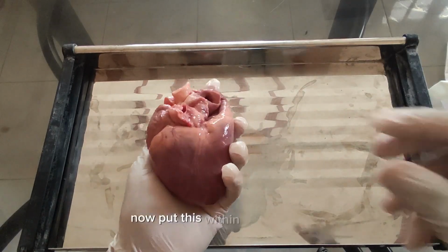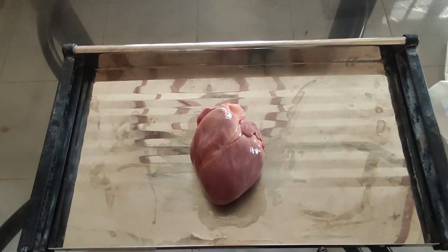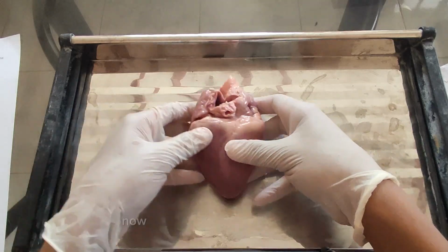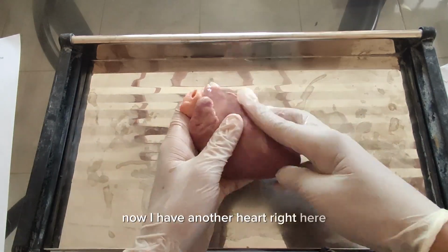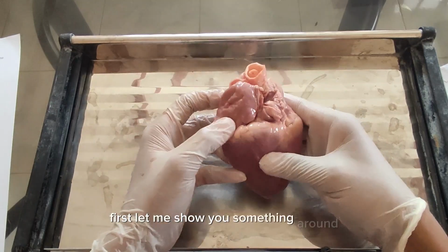Now, let's put down our pig's heart and proceed with the dissection. I have another heart right here which I'll be using for the dissection. First, let me show you something.